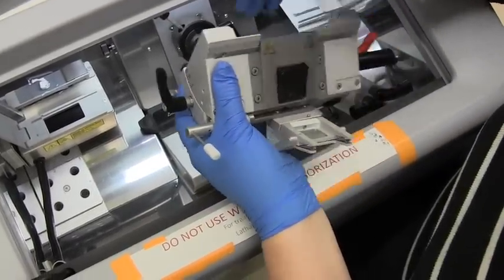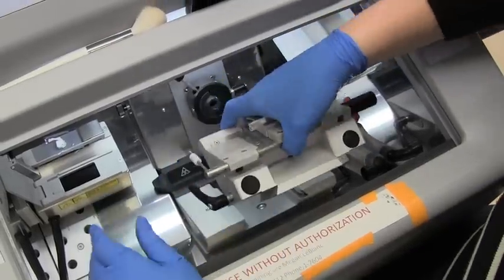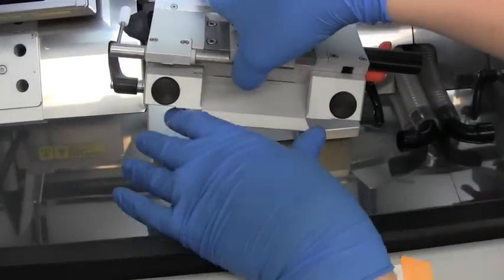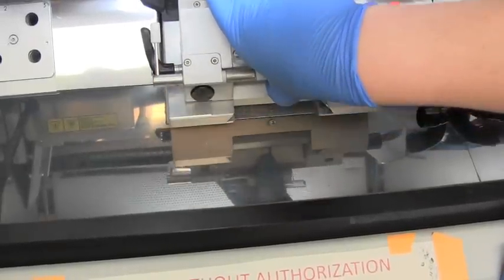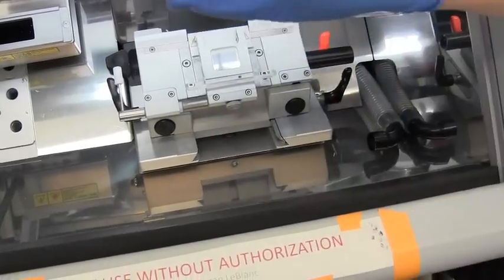Make sure your blade holder is nice and clean. Replace that — there are notches for where it fits in, and this has to go in perfectly. It's all machined to be fairly tight. Once that's in, you can tighten it down.